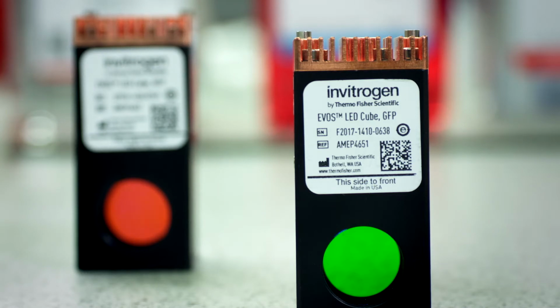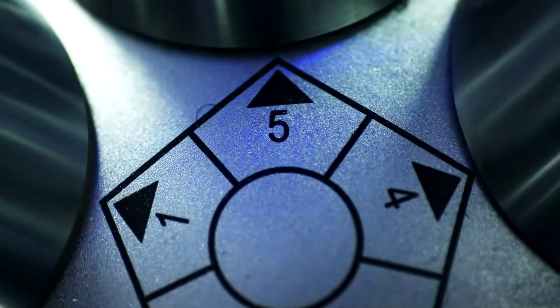Another part is the fluorescence imaging. I usually try out live cell imaging, at least on 5 different day points, and I use those images to monitor my progress. It also makes it easier to report when you're talking to colleagues or your superiors about your research.